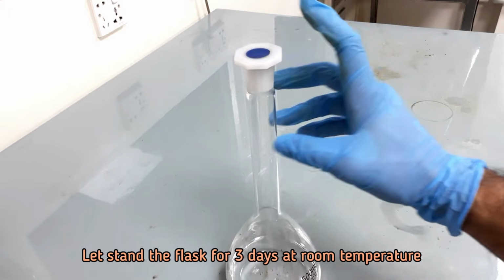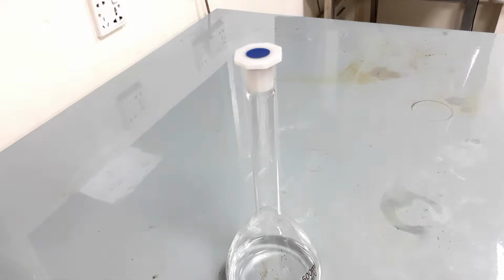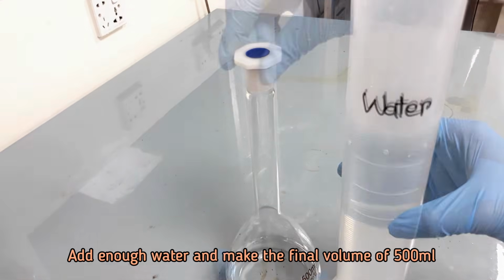Let the flask stand for 3 days at room temperature. After 3 days, dilute the solution to 500 ml with distilled water.